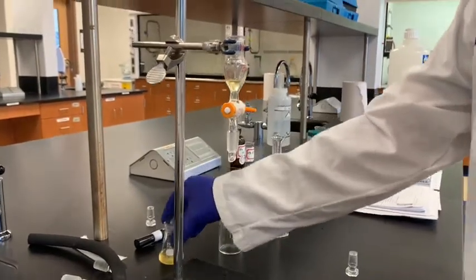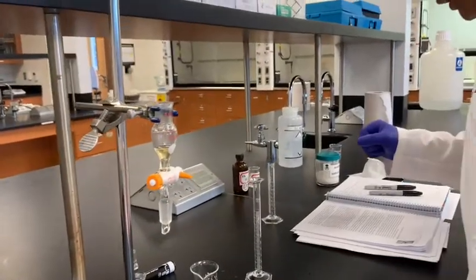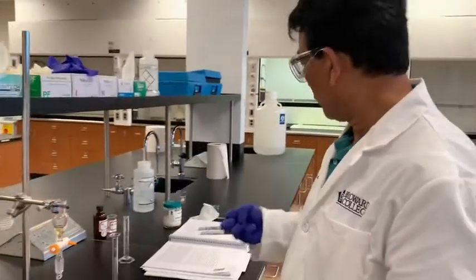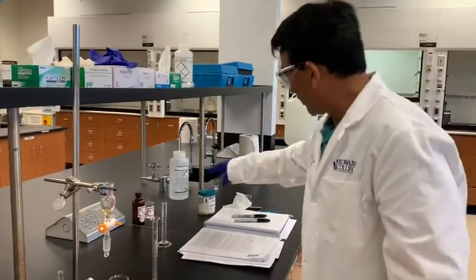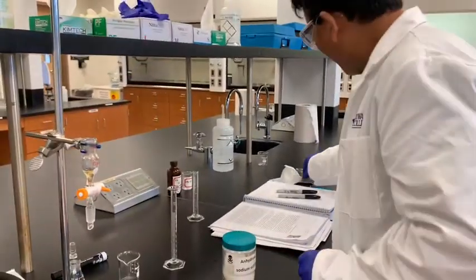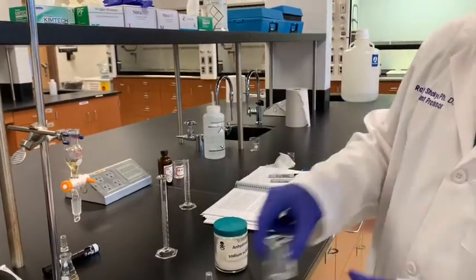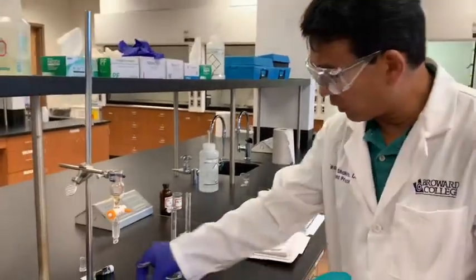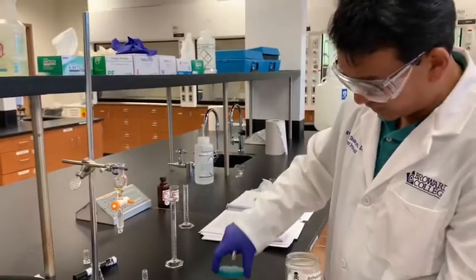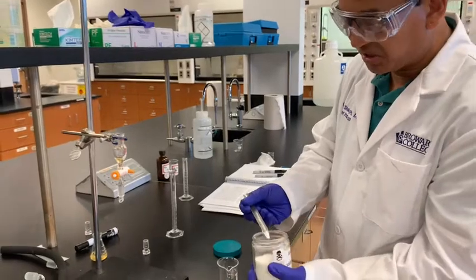Now this organic layer, we need to dry any moisture present in that with the anhydrous sodium sulfate. So here is anhydrous sodium sulfate. We could use about 0.5 gram depending upon the amount of solvent, but again I don't bother weighing that. I will just take a little bit, approximately. It's just a drying agent, so this should be a good amount here.